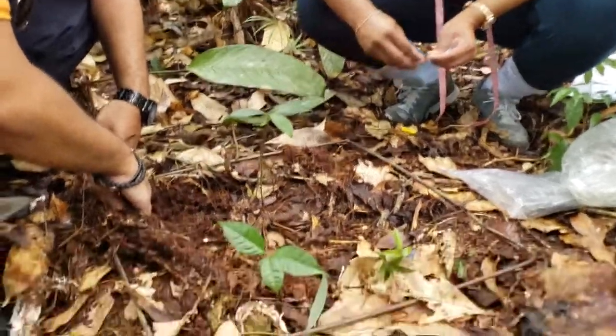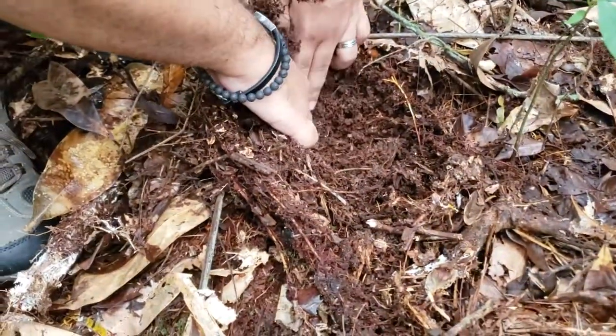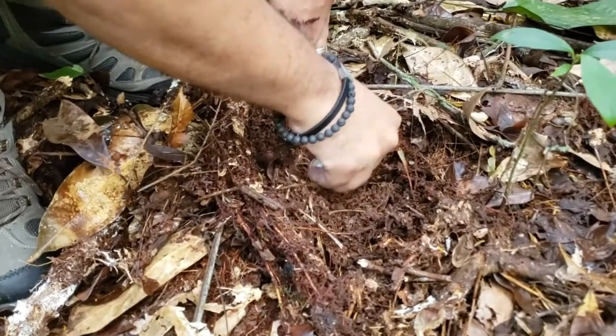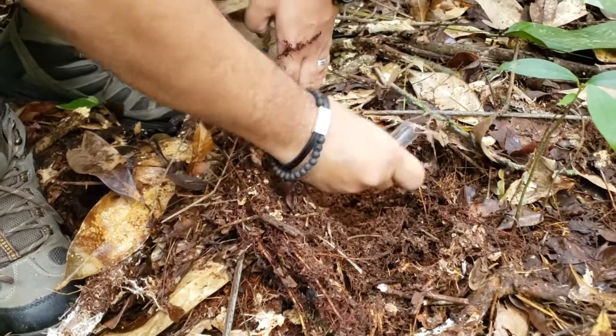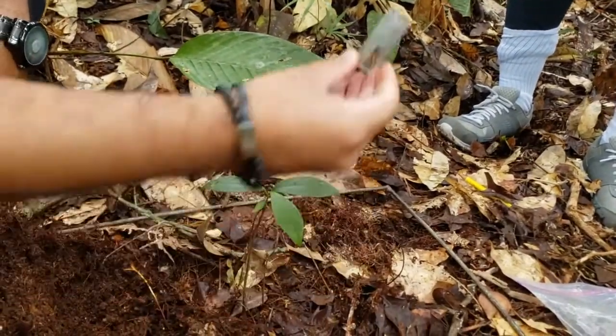A little spider, yeah. Alright, so for the ones that you can't catch, what you can actually do is just take note. If you're not able to catch them... Ooh, that's a big spider. See? It's pretty simple. It's not going to harm you.